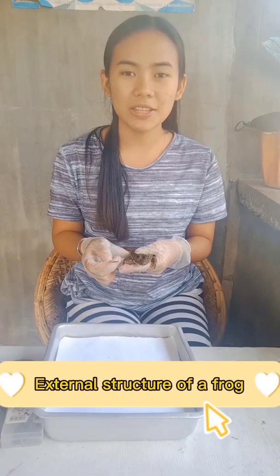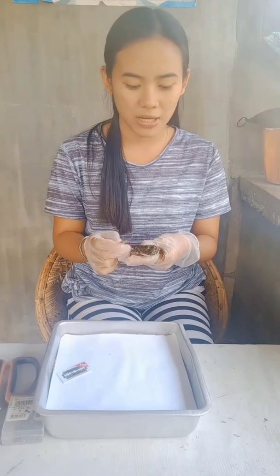For today's video, I'm going to dissect a frog and determine the external and internal structure of a frog. And now, let us determine the external structure of a frog.